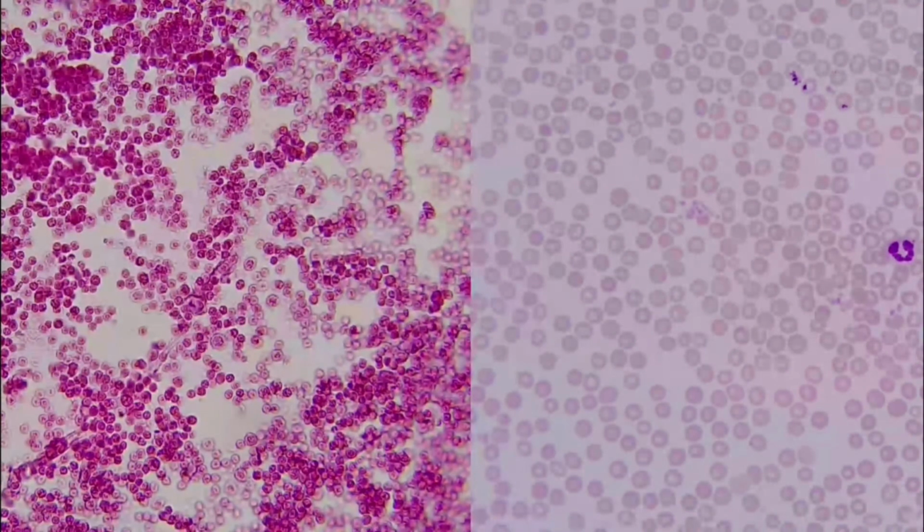So one thing people struggle with a lot is the difference between some reticular tissue and blood. So I want to point out that example really quick. Blood is another connective tissue you're going to have to know. We'll get to that more later. But right here you can tell that there's nothing really inside of these cells, right? Red blood cells kick out most all their organelles just to carry oxygen, right? And so we can see we have all of these, they're completely empty.